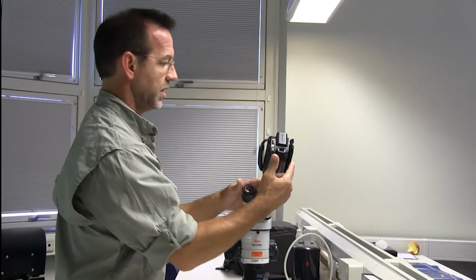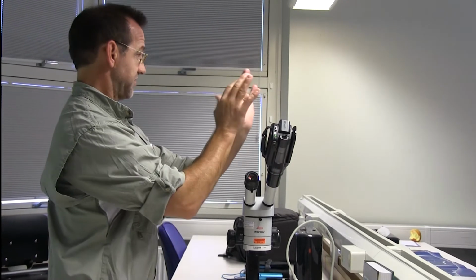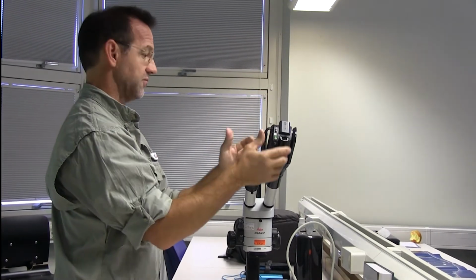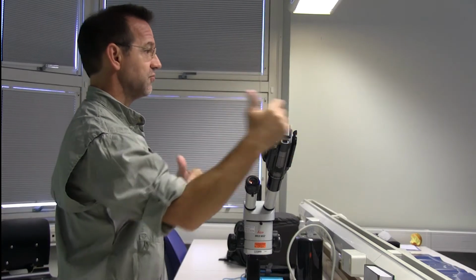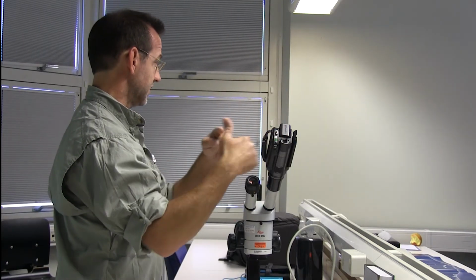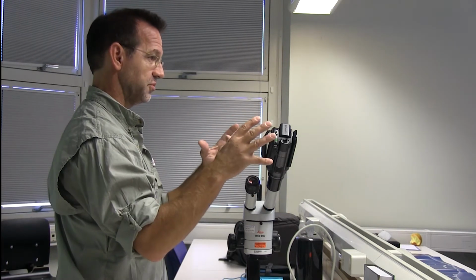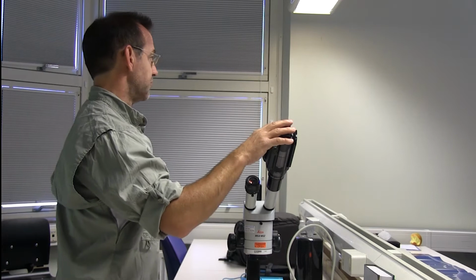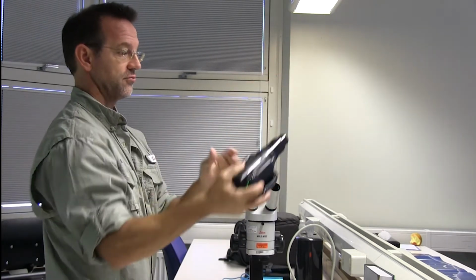So at first, when you bring up this camera image, you may see just a circle of light, so you have to zoom in to get it to fill the screen. This afternoon, when we're doing our sampling and looking at the live samples under the scope, I'll show you exactly how that works. But this is an older system. That's how this camera system works right here.